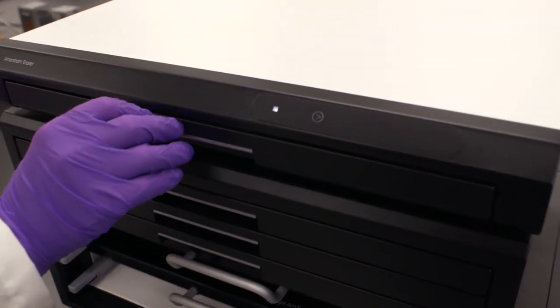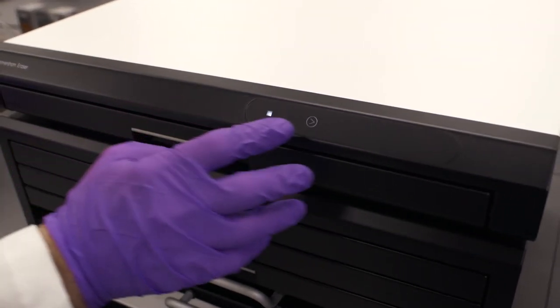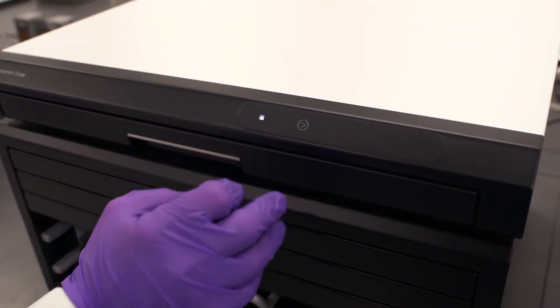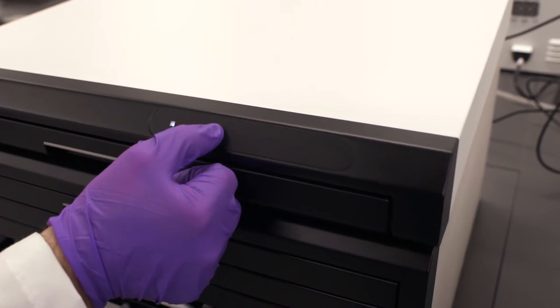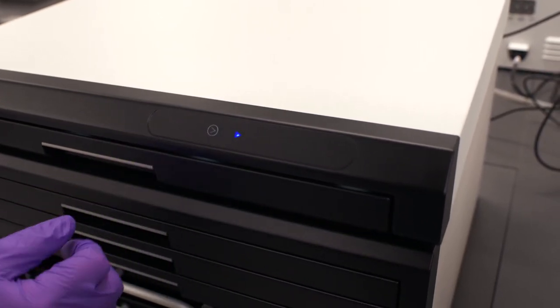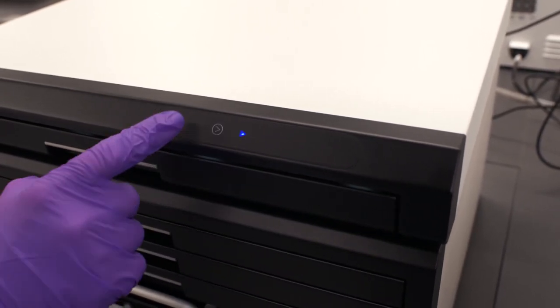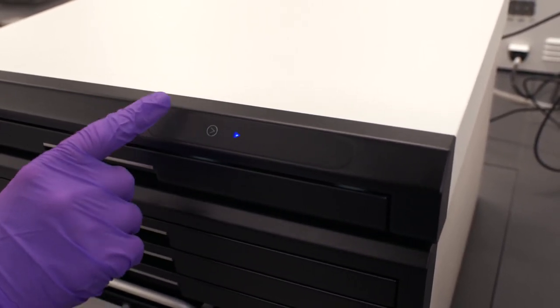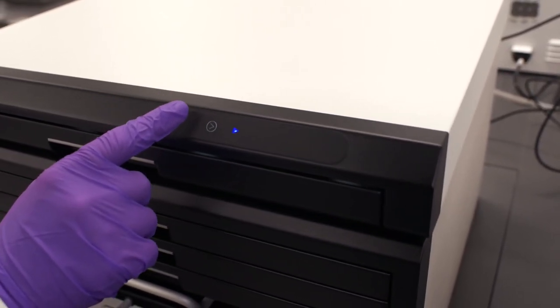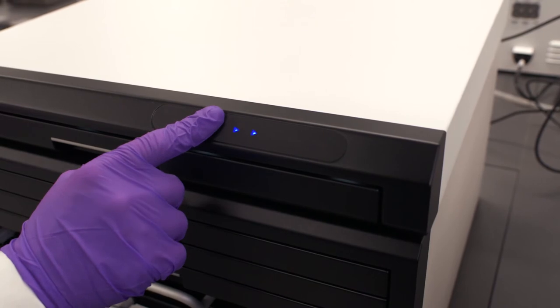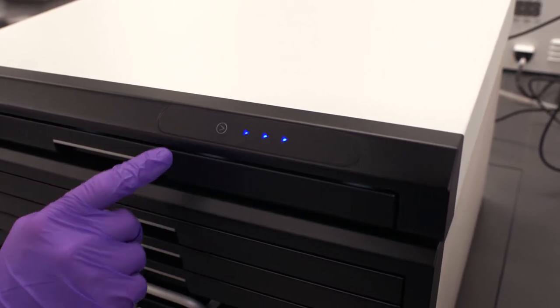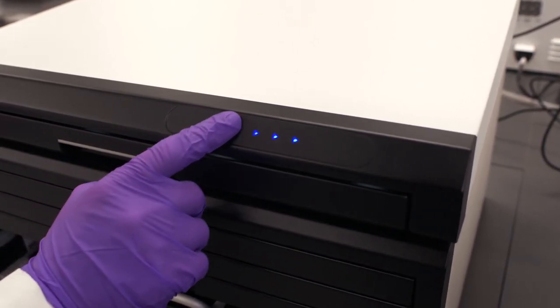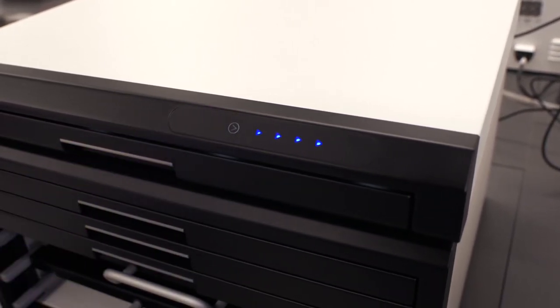We're going to close the drawer. We have this button available to us now and each time we press on this we're going to increase our time of exposure to erase the screen. So the first will be 10 minutes then we could do 20, 40 and 60.